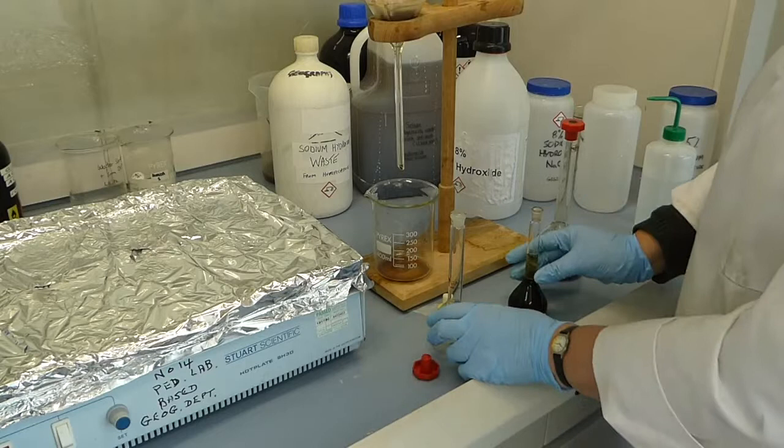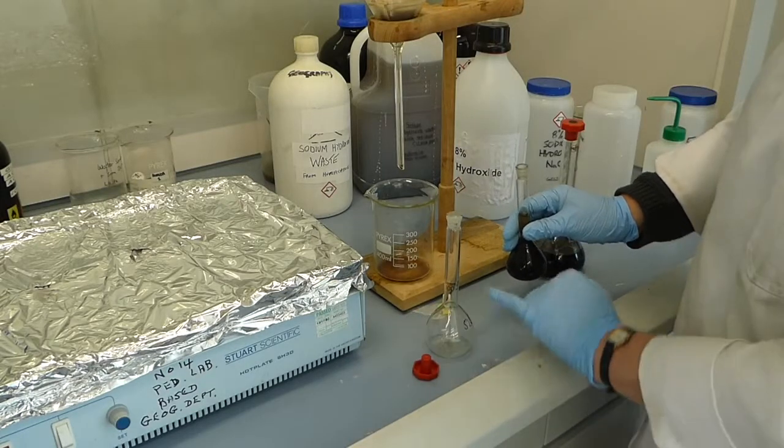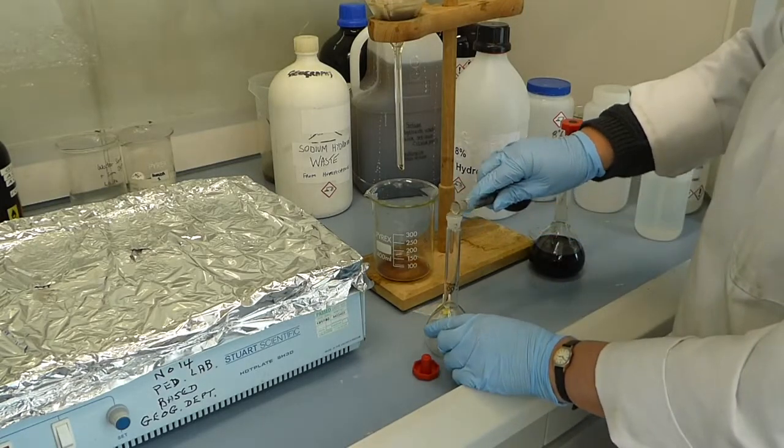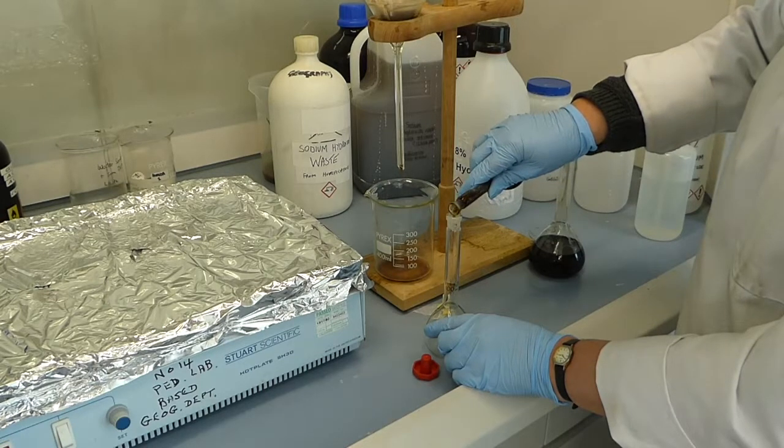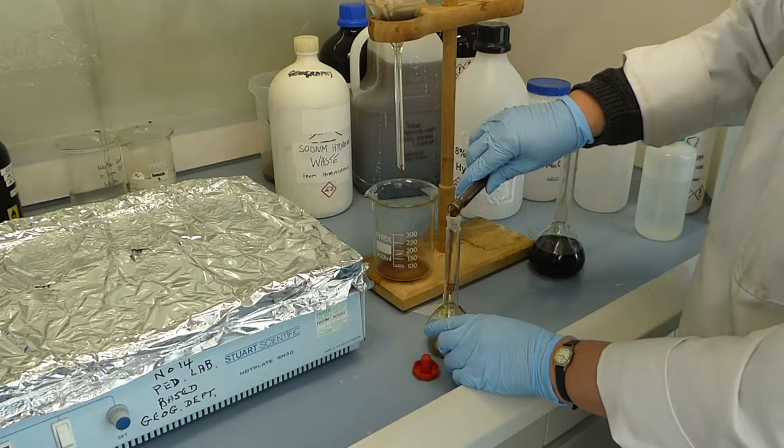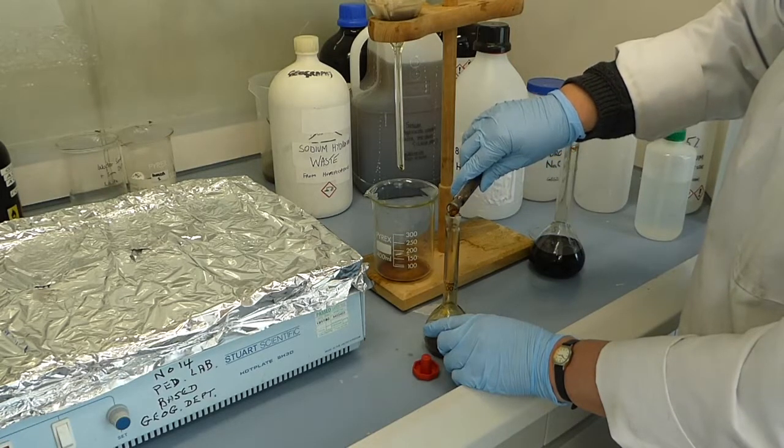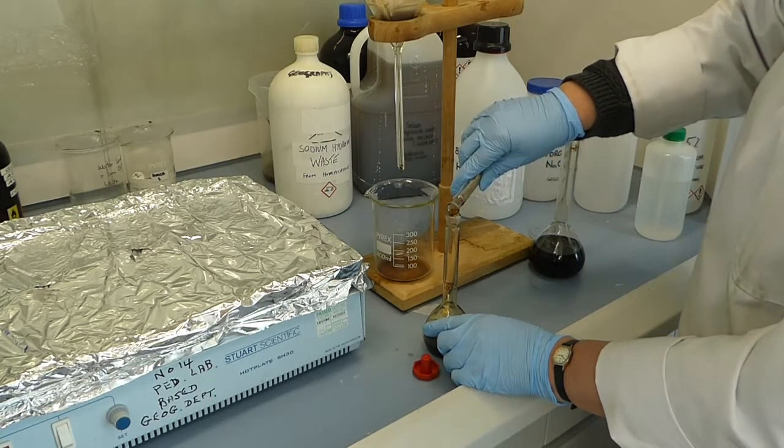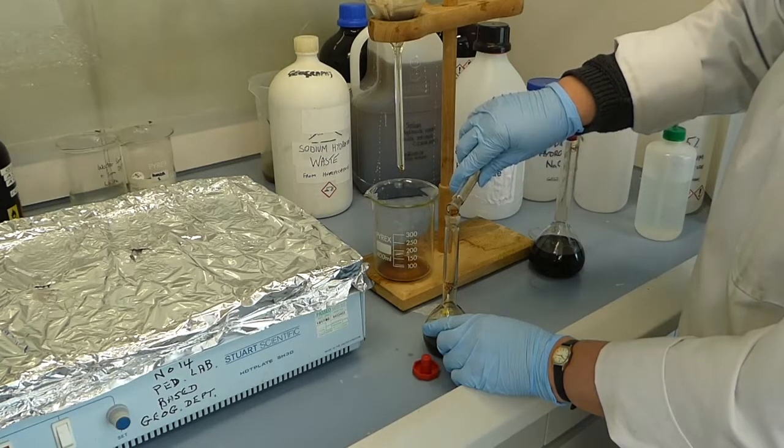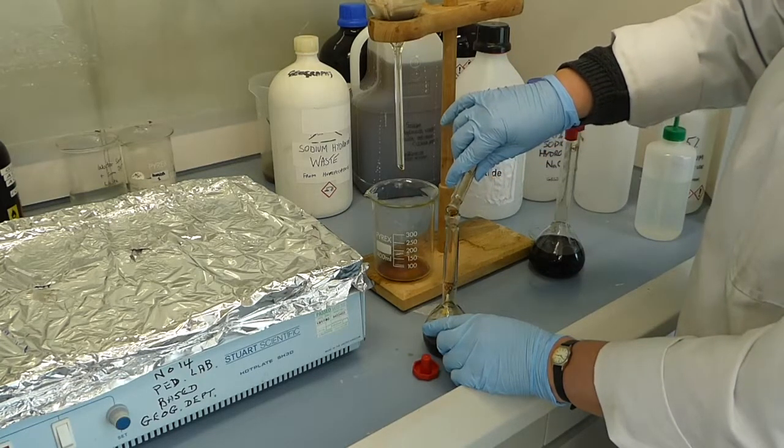You then want to tip that 50 ml solution into a 100 ml volumetric flask. Try and get it all in without spilling. You could use a funnel for this part as well if you wanted to.